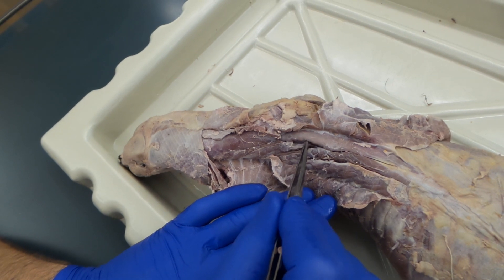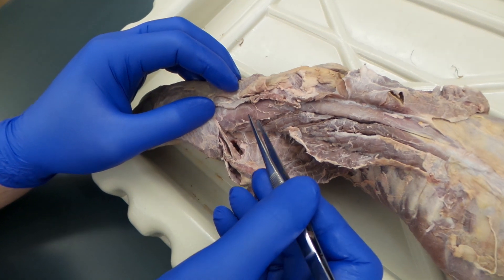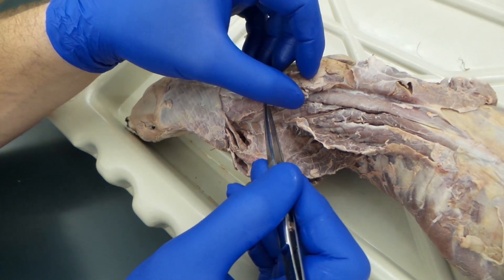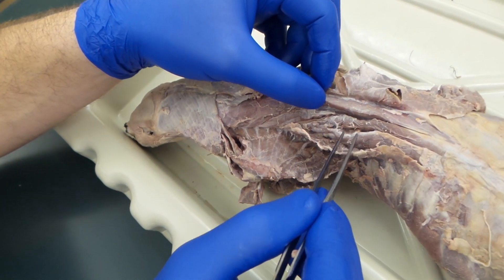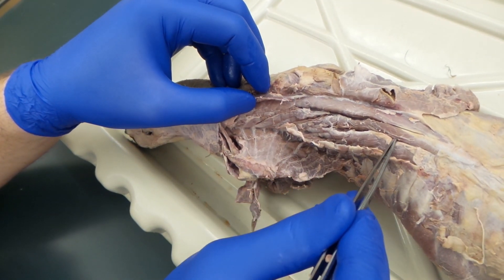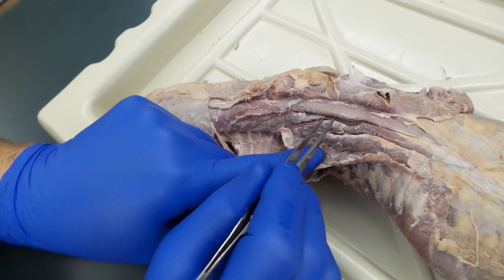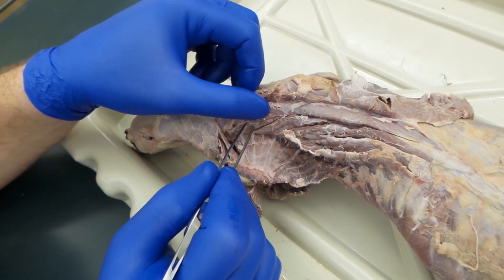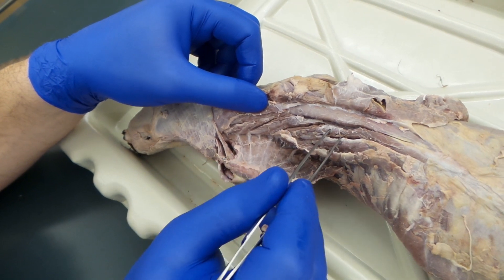Take the fascia and help separate out some of these other muscles. First we have our splenius — a triangular muscle. Then we have our spinalis dorsi. Everything in between your iliocostalis, spinalis dorsi, and splenius right here — that's the longissimus dorsi, which we can subdivide into the longissimus thoracis, longissimus cervicis, and the longissimus capitis.